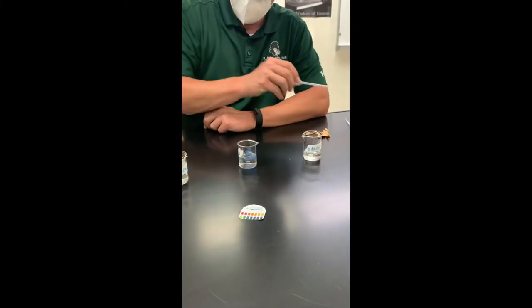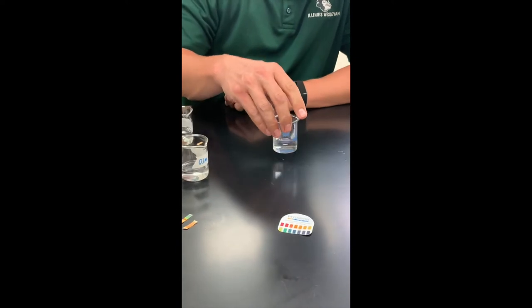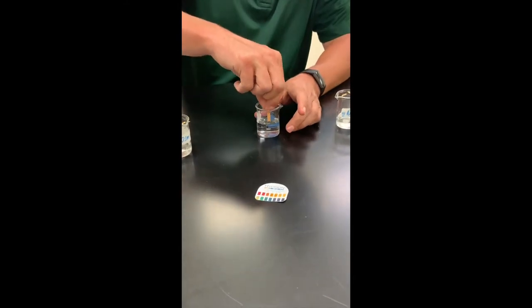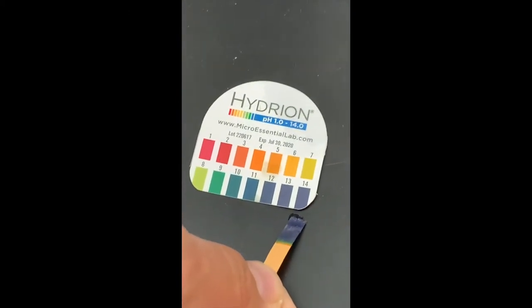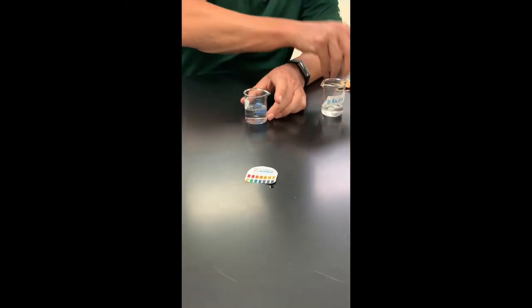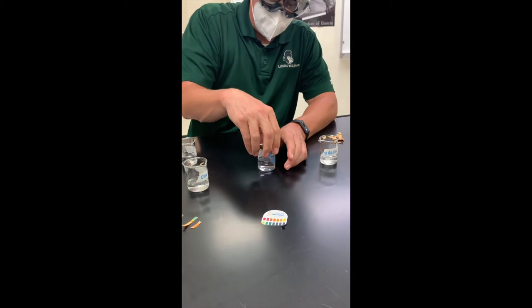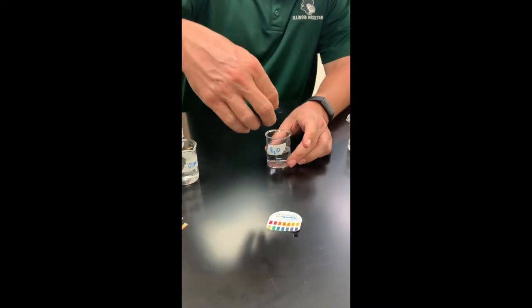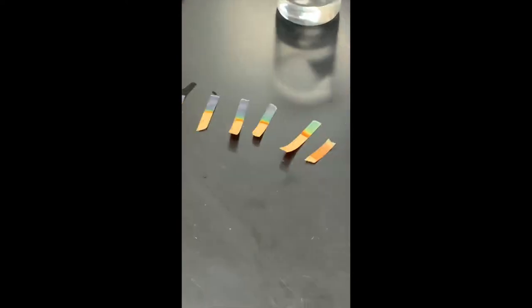All right, and then we're going to do that two more times. That is our fourth milliliter of 0.1 molar NaOH that we've added. I'm going to take the pH — and that looks to be about at a 14 now. We've got one more to do. Last milliliter of NaOH added to our H₂O, and still at a 14. So that is the impact of a base on the pH of water.